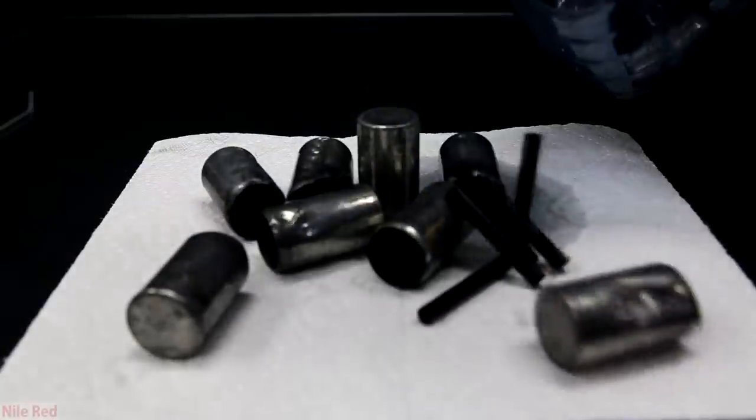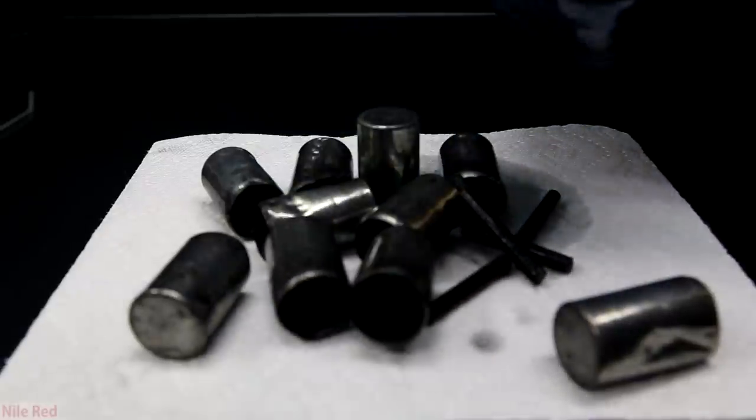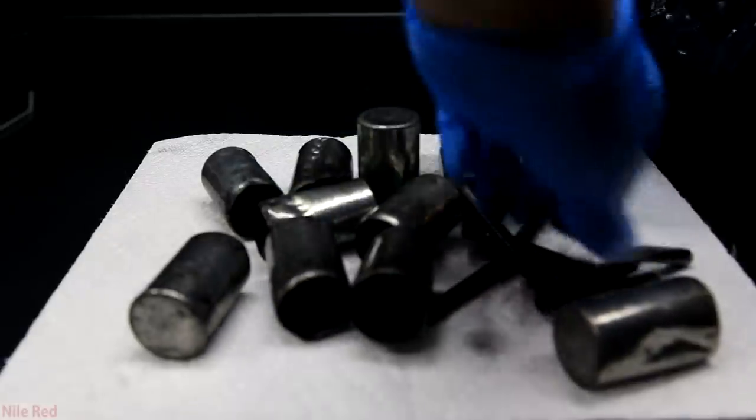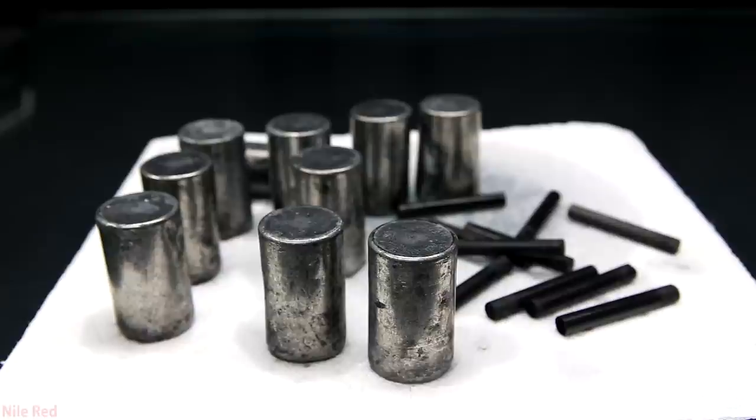At the time I didn't really have an amazing way to clean it but I figured when the time came that I wanted to use these in something I would clean them better. So I left all of the zinc and the carbon rods out to dry and then I put them away.